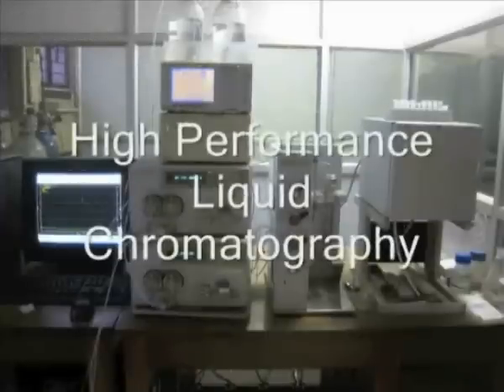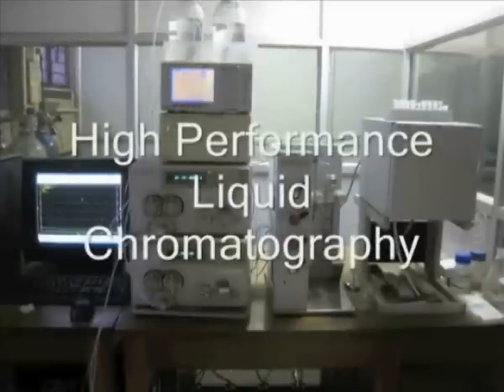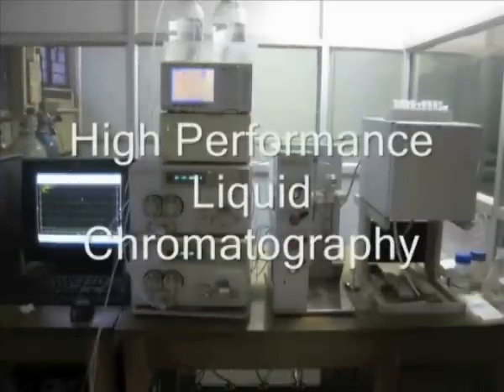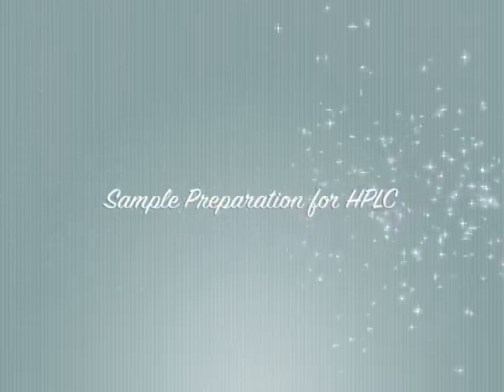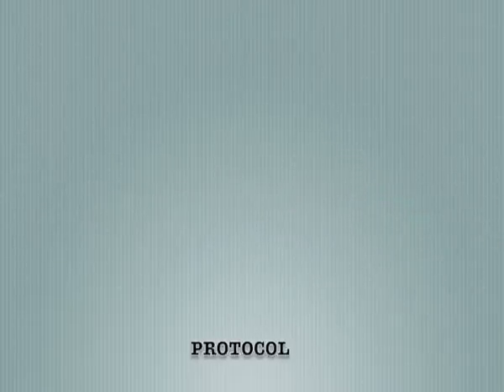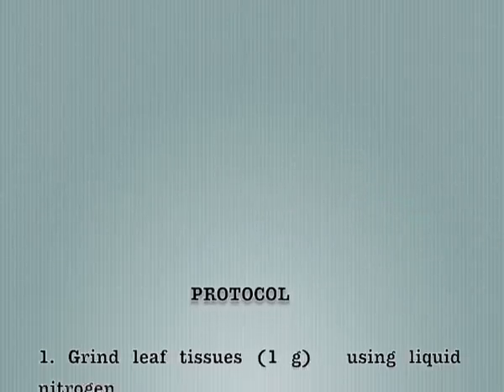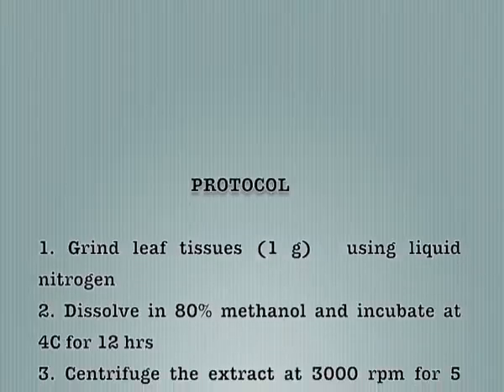High-performance liquid chromatography is used to separate and identify molecules in biological samples. This is the protocol to be followed for sample preparation for HPLC.